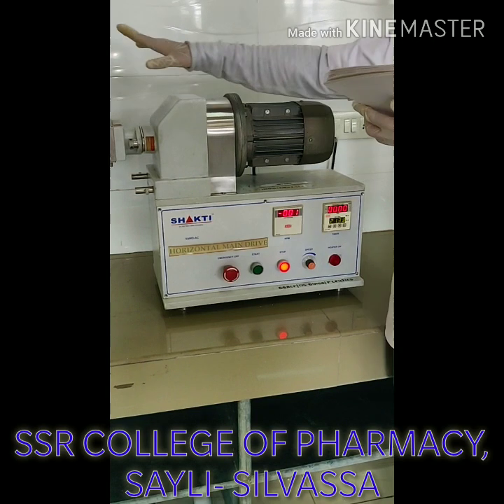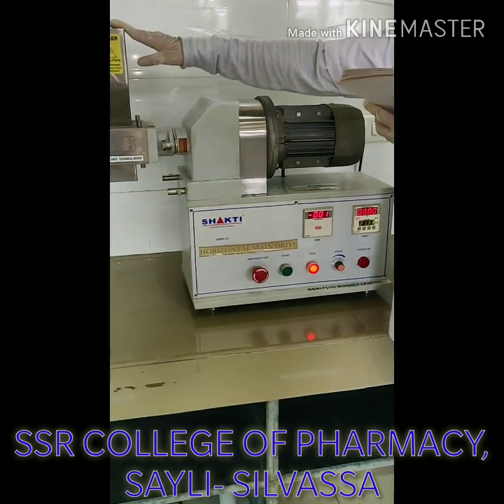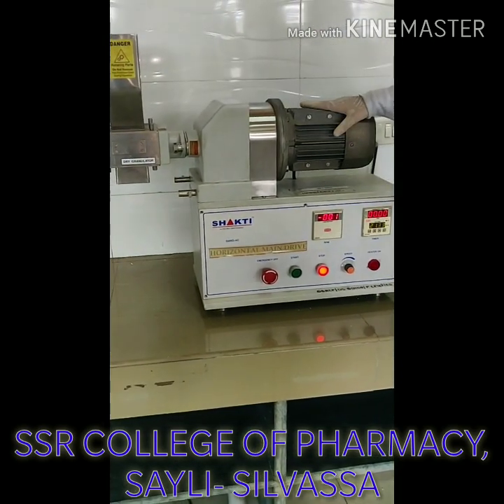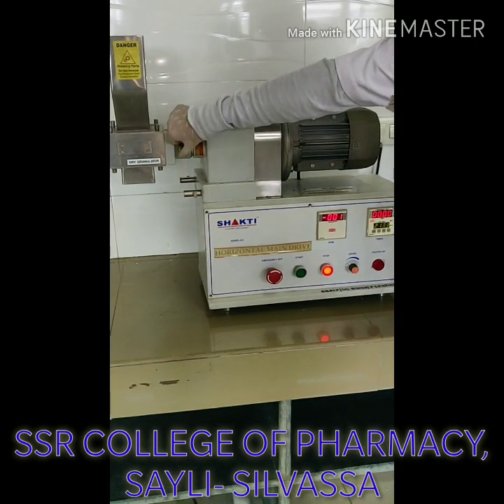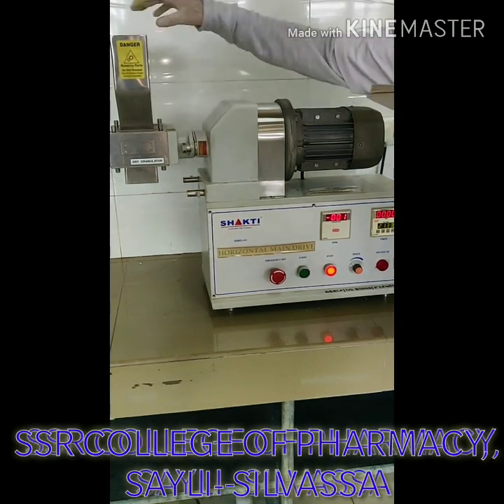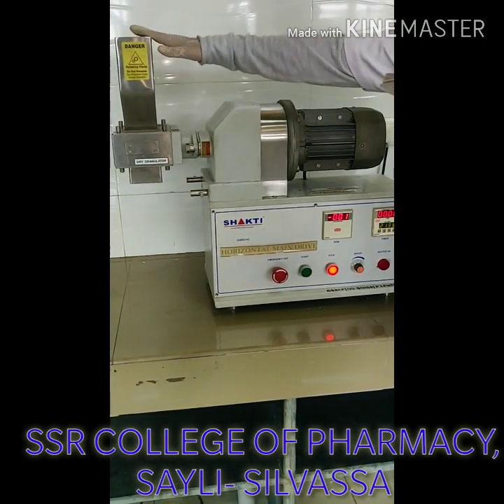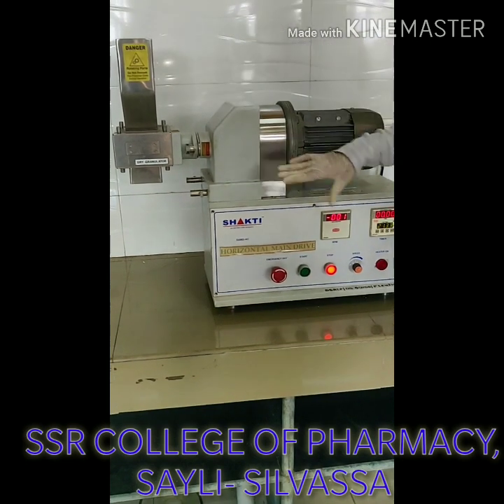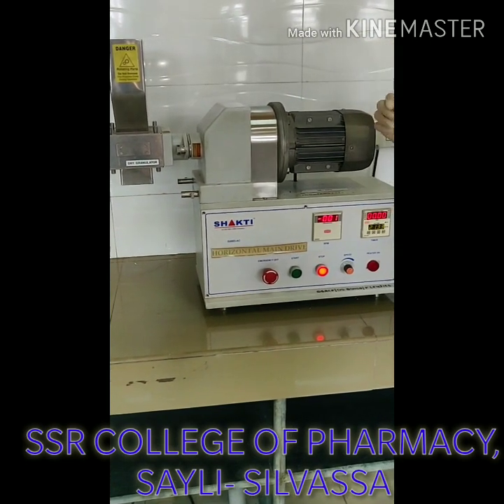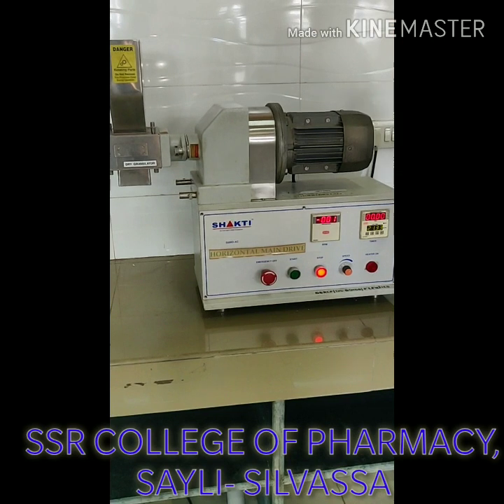This is the unit of dry granulator. This unit is attached to the main drive by adjusting two knobs. These two knobs are adjusted to attach this main drive, and it has to be run at 50-60 RPM for getting a specific or optimum operation.